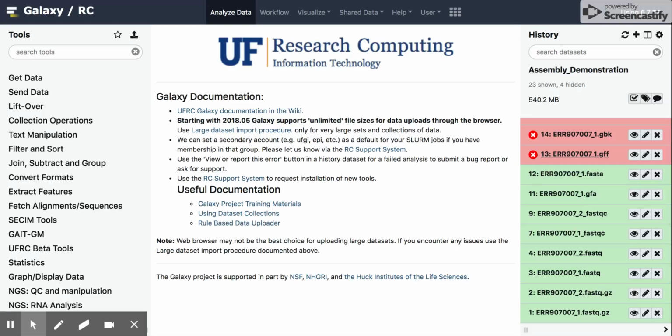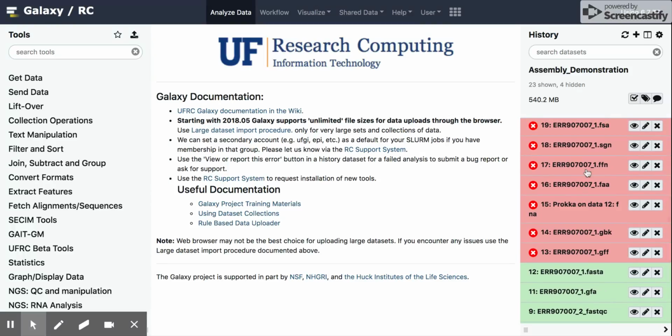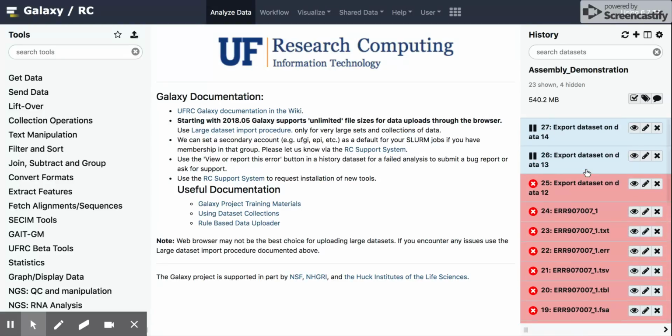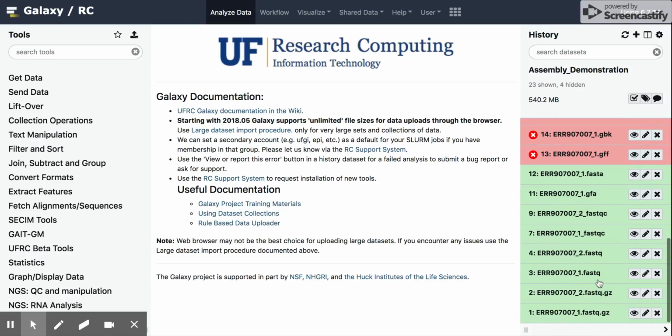Just a quick review: if we scroll through the history on the right-hand side, we'll see some things that are green, which means they were run successfully. A number of items that were red, which I had expected to fail, are from our annotation step using Prokka. And then a couple of steps in blue, which are paused because the preceding steps have failed. So we can go through each one of the steps in the pipeline.